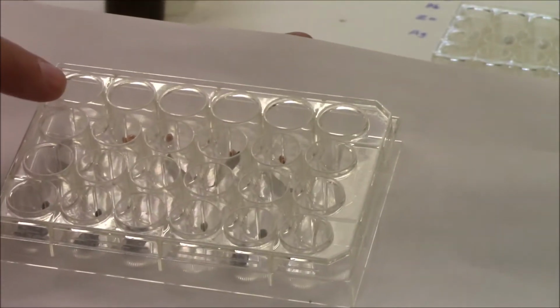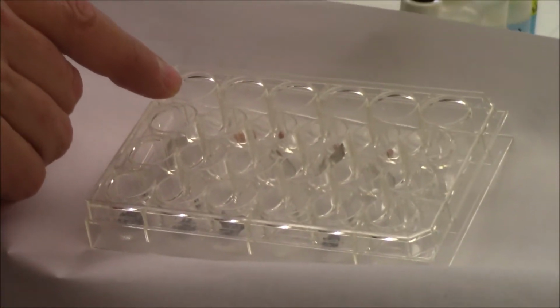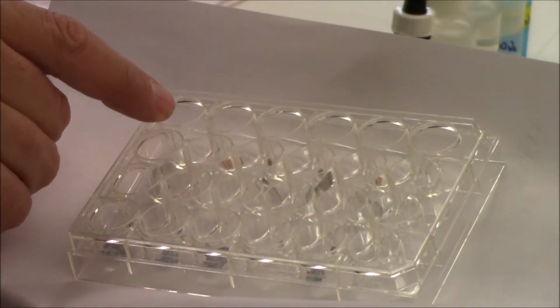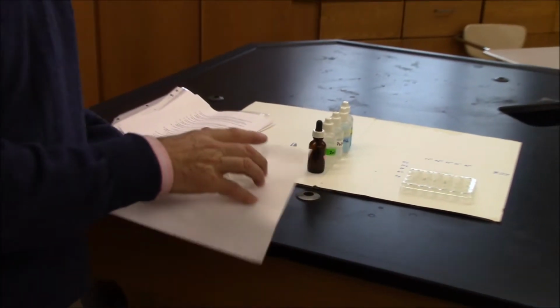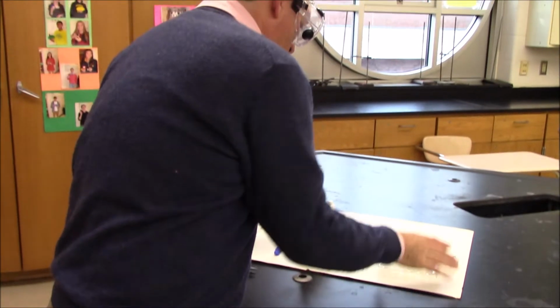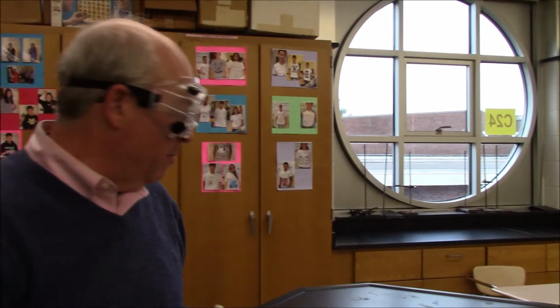Okay. So we've got copper, magnesium, lead, zinc, and silver here. And you notice there's blank squares because it doesn't really make any sense to react copper nitrate with copper. So on the chart, those are already X'd out for you. So what we're going to do now is we're just going to add some of each solution and then come back and look.